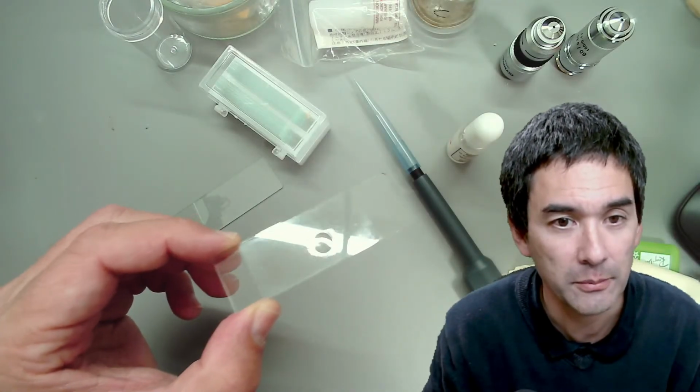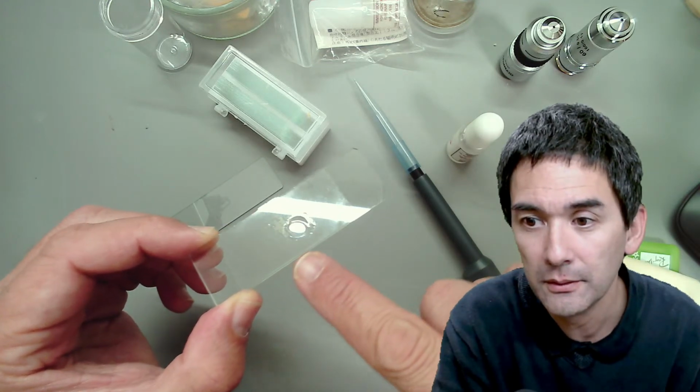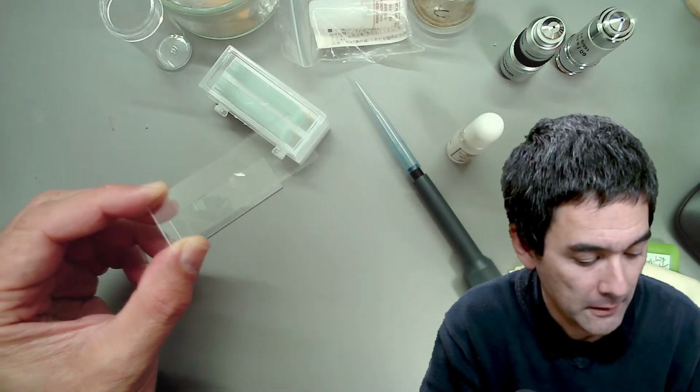Because you might be able to, of course, see that there is a little bit of oil on the cover glass, the cover glass being here pretty big. So that's number one that I would like to do.